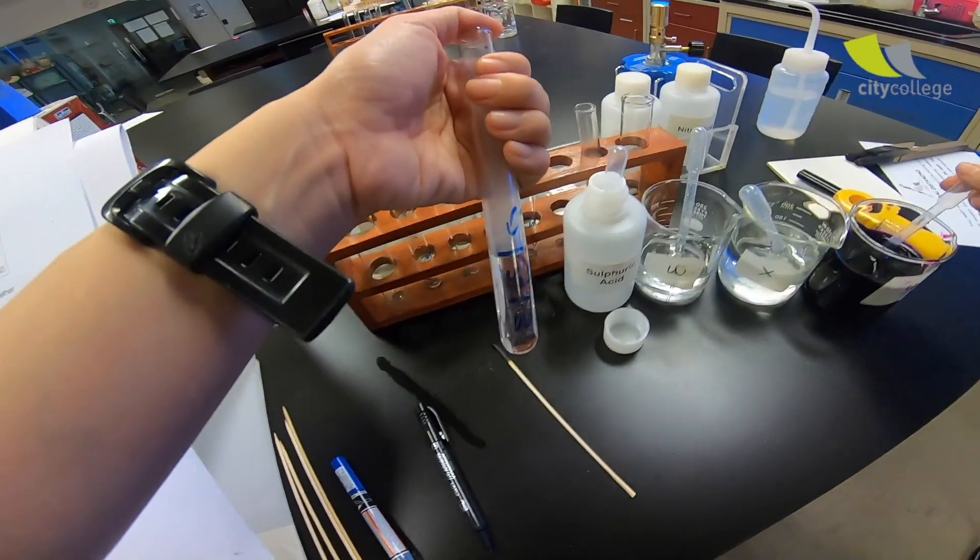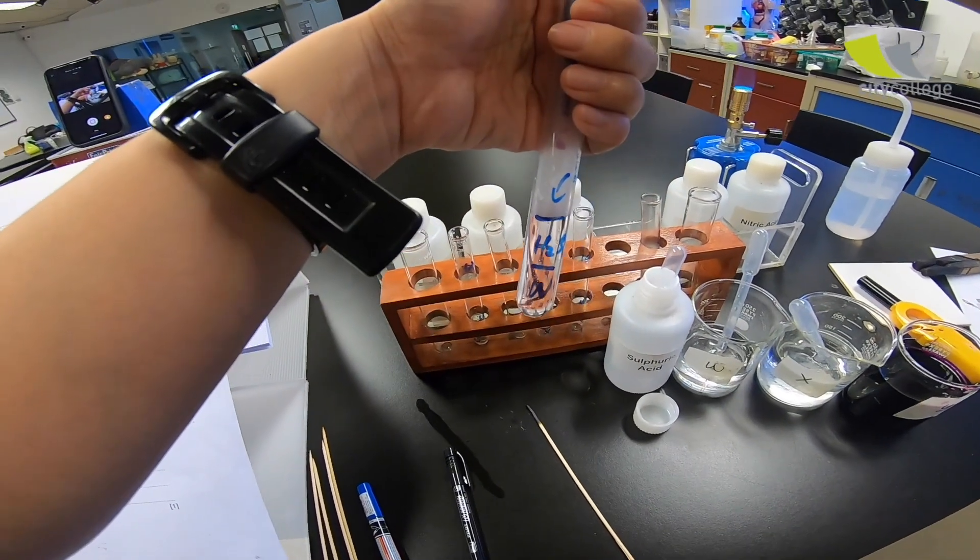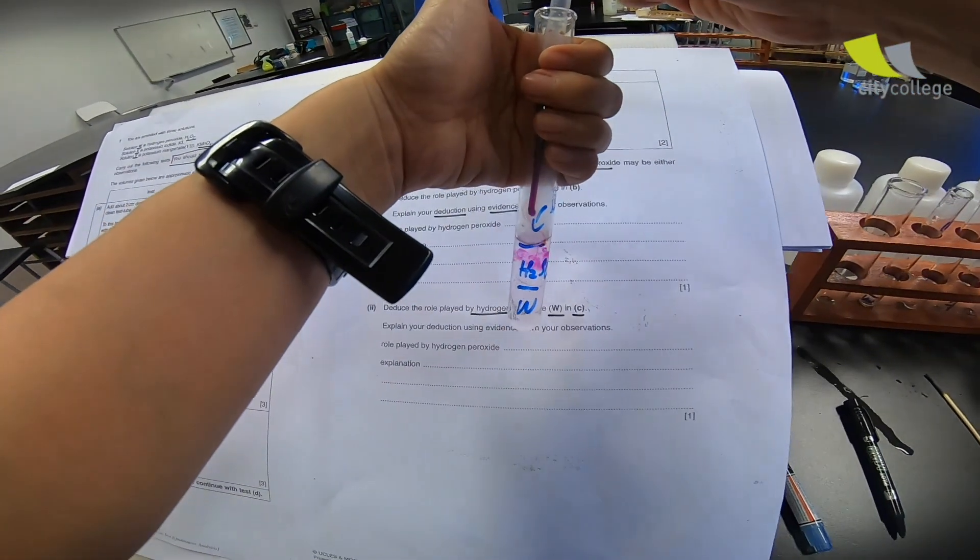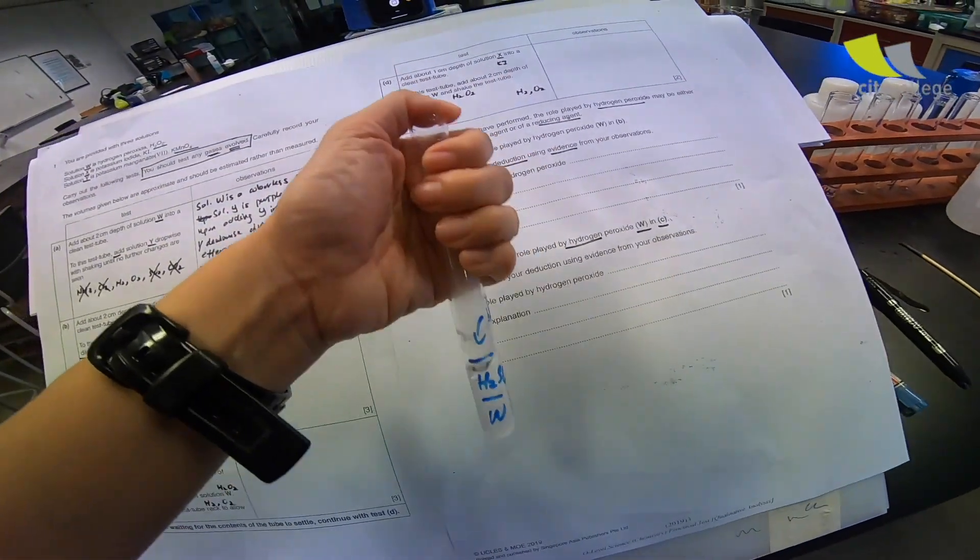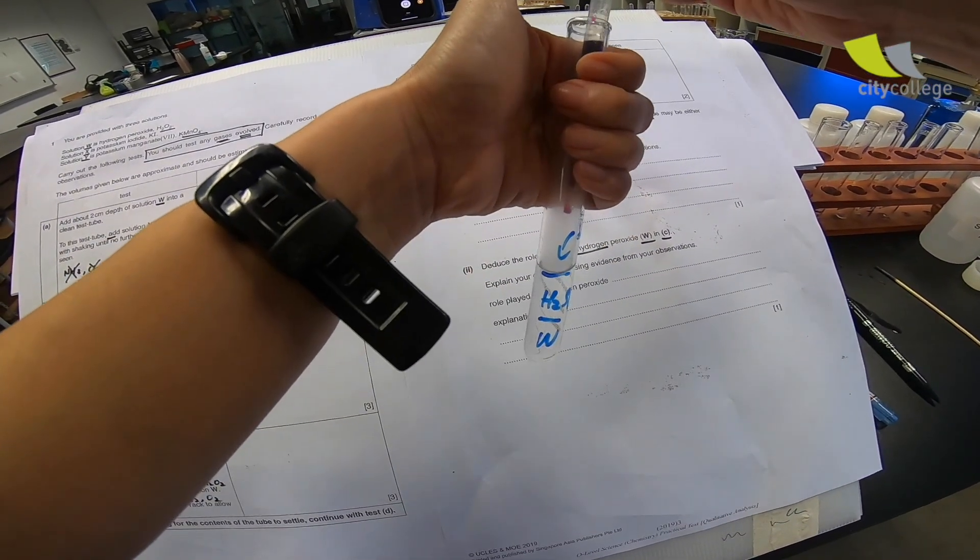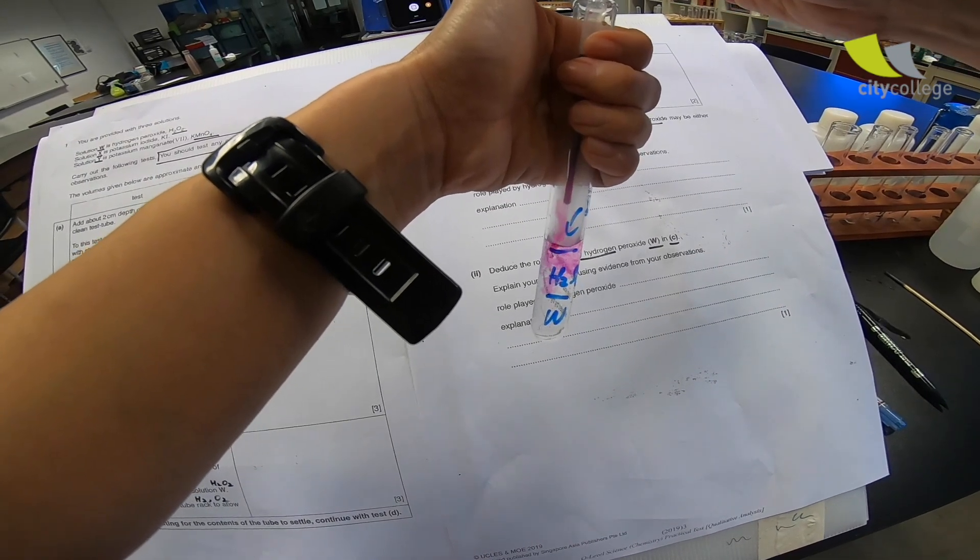It doesn't seem to be lighted, but I'm going to add some more. 1, 2, 3, 4, 5. Shake. The purple decolorize. 1, 2, 3, 4, 5. The purple decolorize. 1, 2, 3, 4, 5.